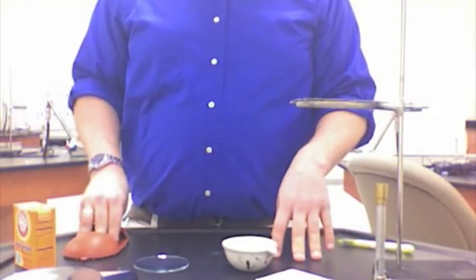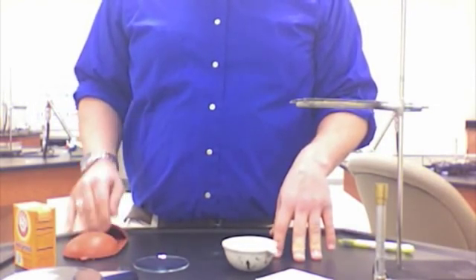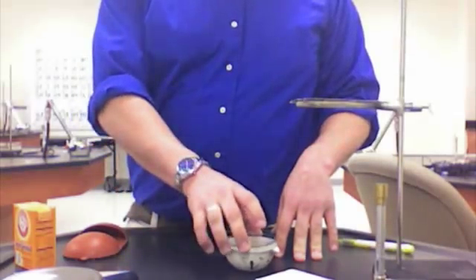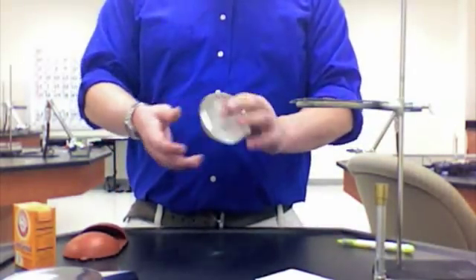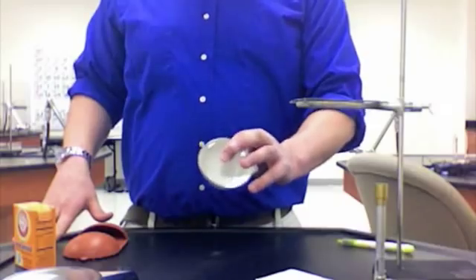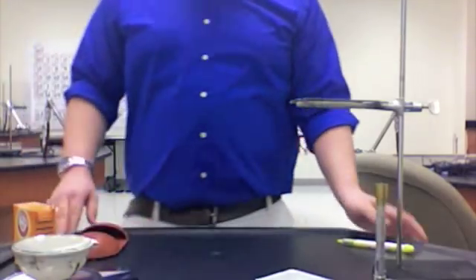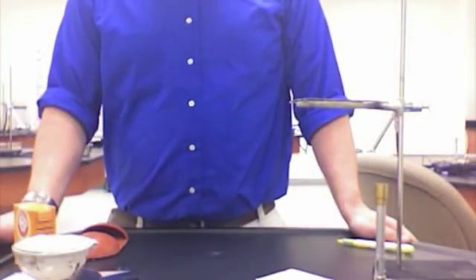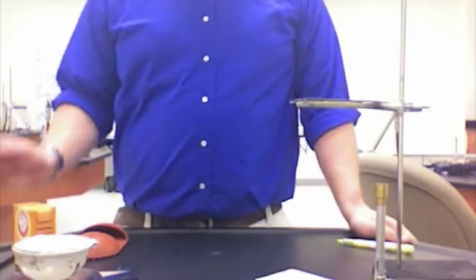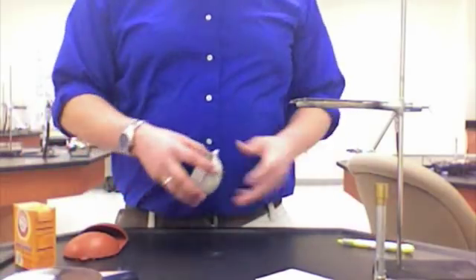Now, we're going to have to do some calculations and take some measurements along the way. The first thing we're going to measure is our evaporating dish and watch glass. We're going to put them on our balance and get the mass. We take the mass and see that we have 108.49 grams, measured to the hundredths place.